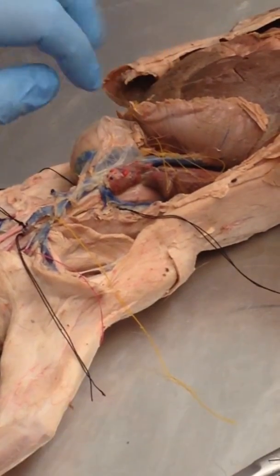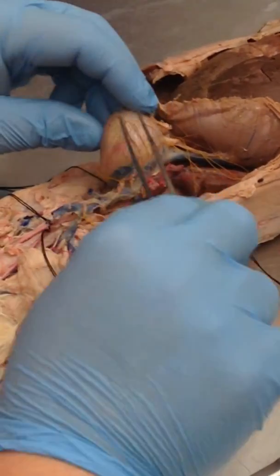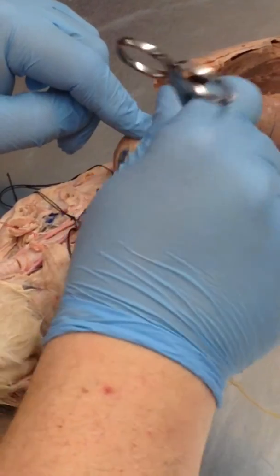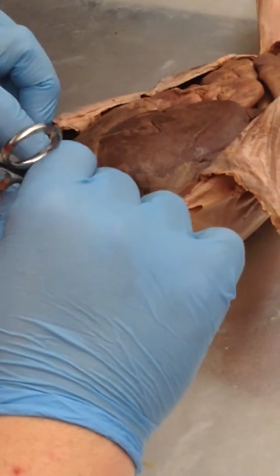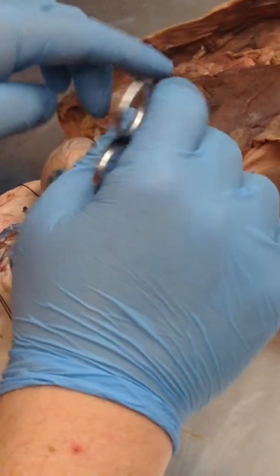Other stuff on here you want to know: the pericardium itself is mostly removed, but there's the pericardium, cut. Lungs, mostly removed as well. You've got lungs here, a little bit here. A lot of those have been removed so you can see better. The diaphragm is here. Again, you should be able to see the phrenic nerve as it innervates the diaphragm. Now, review the abdominal stuff as well, because we'll have some abdominal on here.